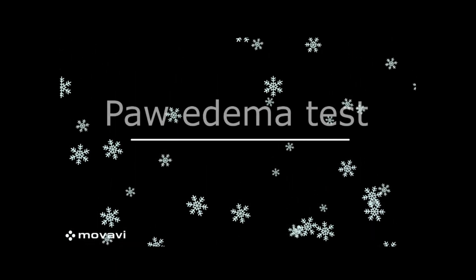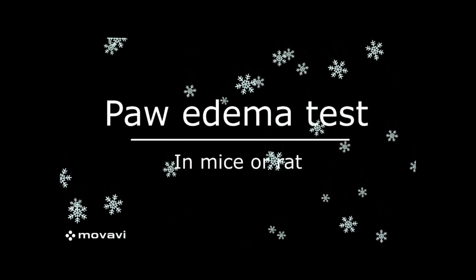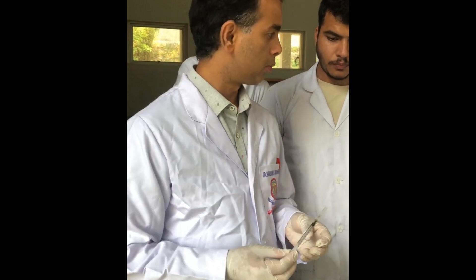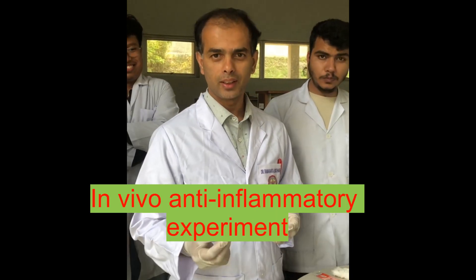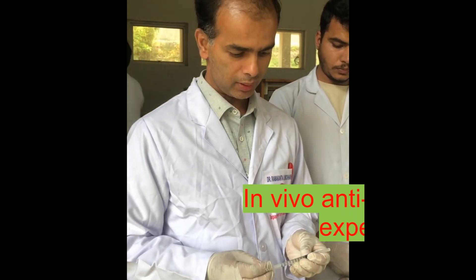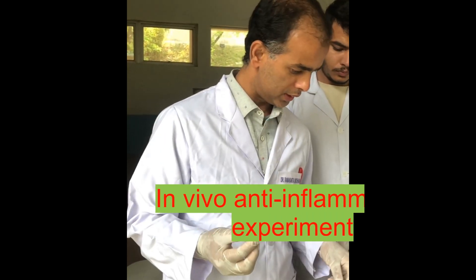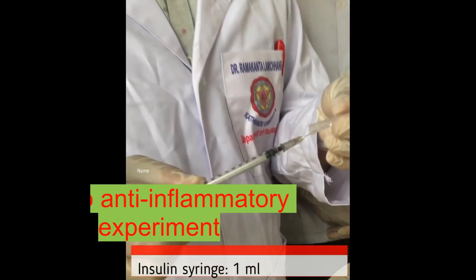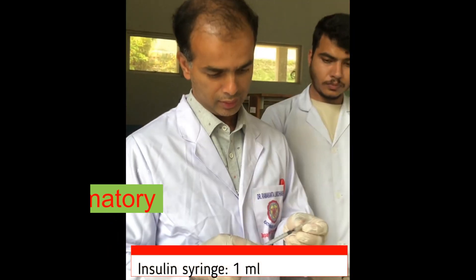It is also called the paw edema test. We are going to start an in vivo anti-inflammatory experiment, also called the paw edema test. We are going to use this insulin syringe, which is a 1 ml syringe and is better suited for this experiment.